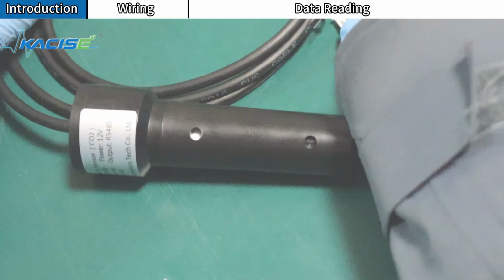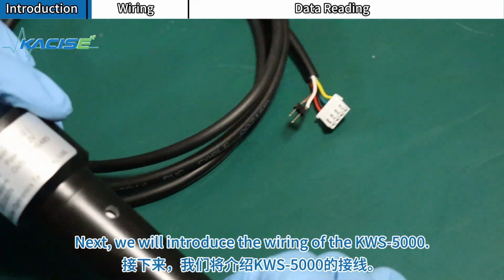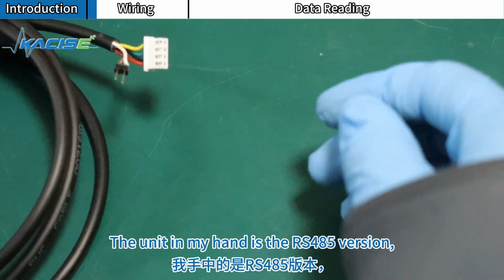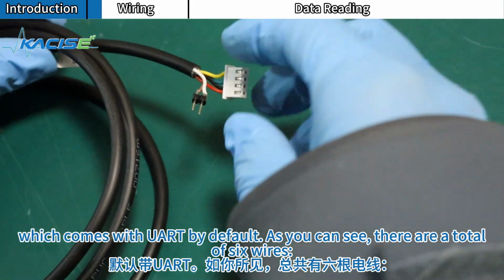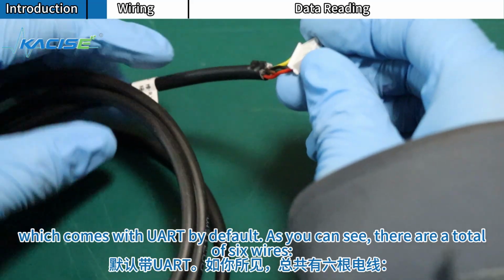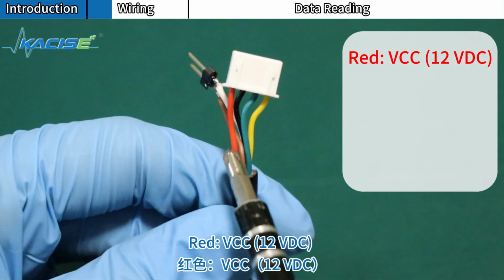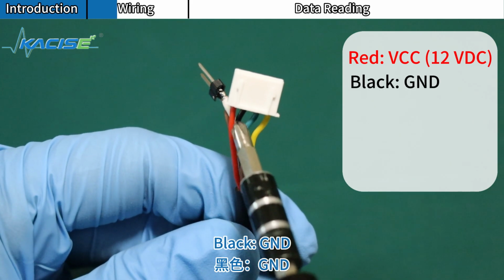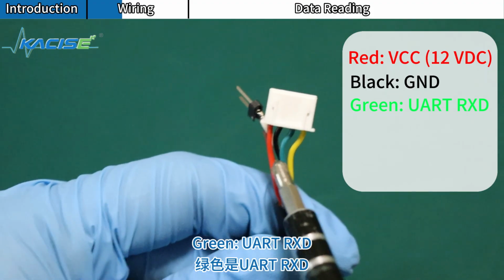Wiring. Next, we will introduce the wiring of the KWS-5000. The unit in my hand is the RS-485 version, which comes with UART by default. As you can see, there are a total of 6 wires. Red, VCC, 12 VDC. Black, GND. Green, UART RXD.